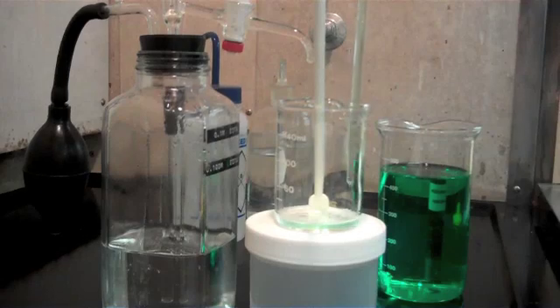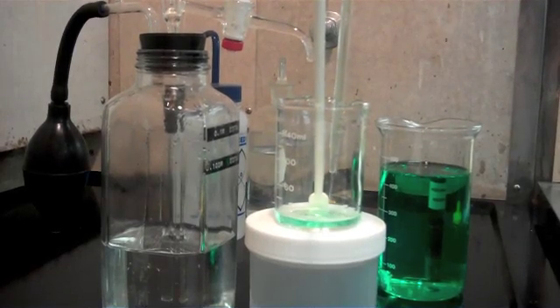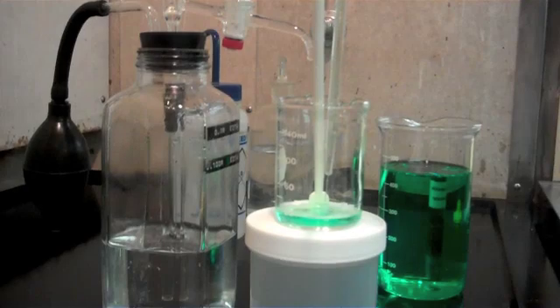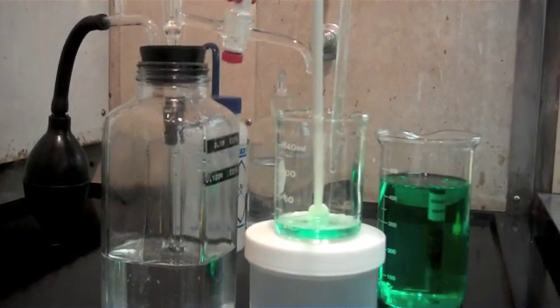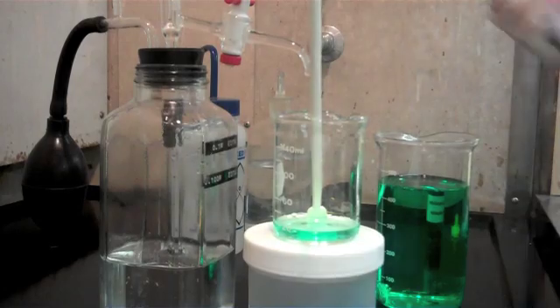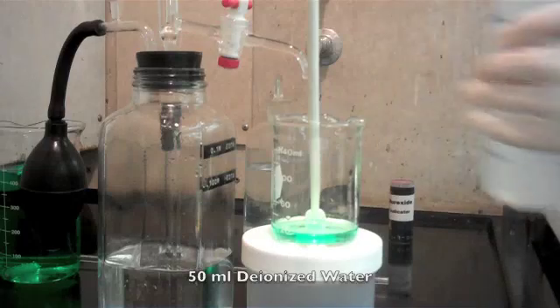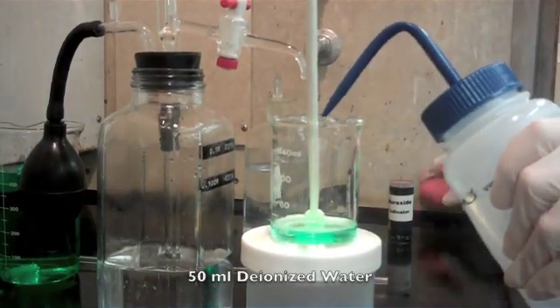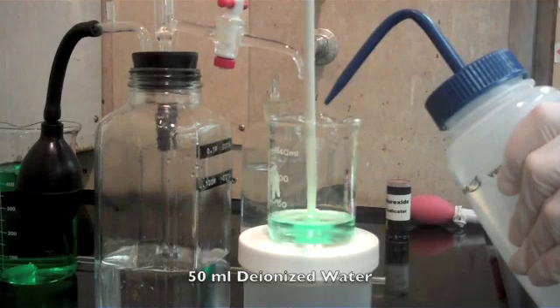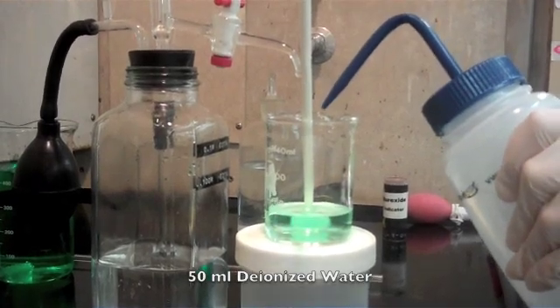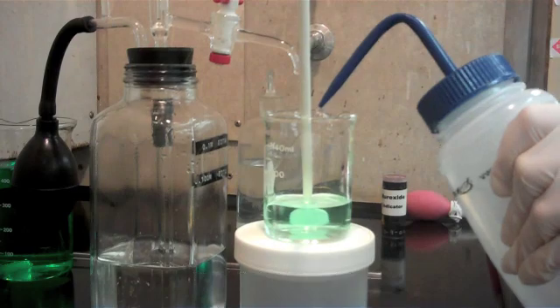I have a 150 mil beaker for this. Size doesn't really matter as far as the beaker goes as long as it's clean. Once we've placed our sample into the beaker we're going to add 50 mils of deionized water. The amount of water isn't critical, we just want to have some volume here so we'll be able to see our color endpoint.